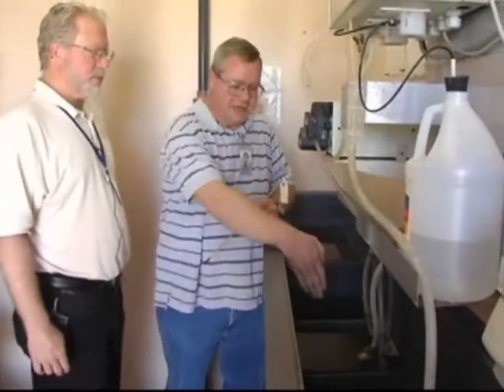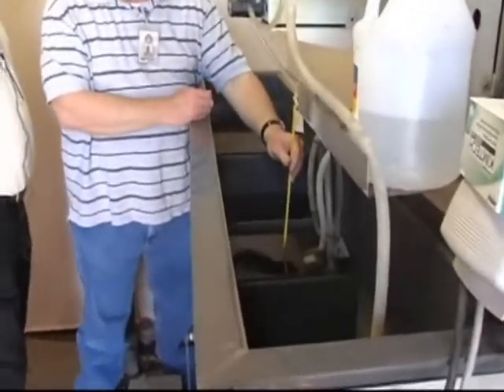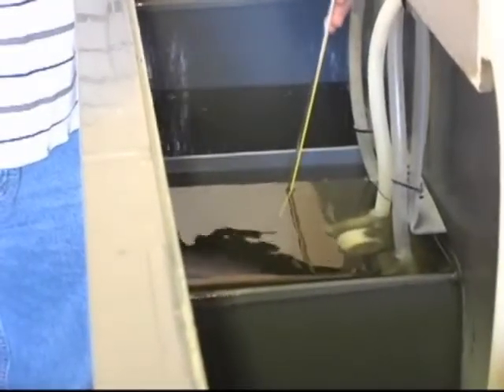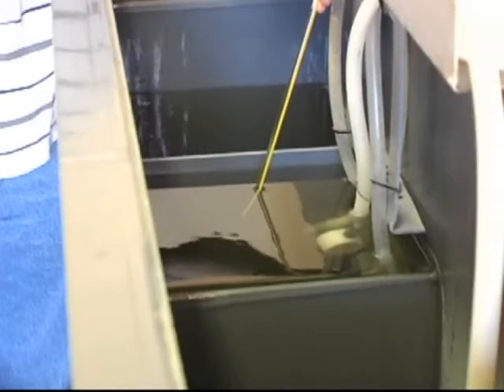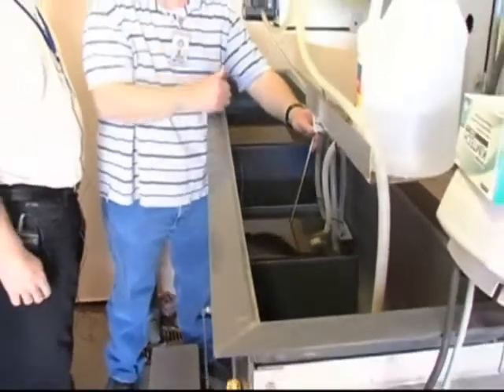So how would you take the temperature here? We take our temperature in the last baffle area. This is the area that we sample for everything else, so we place our thermometer in the last baffle area up to the mark. And if you're good enough, you can read it while it's in there. So we've got it stabilized, put it into the water. This is constantly flowing, so it's going to be a constant temperature — we don't have to worry about it changing like the outfall.